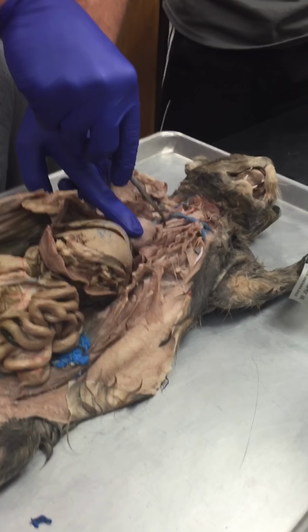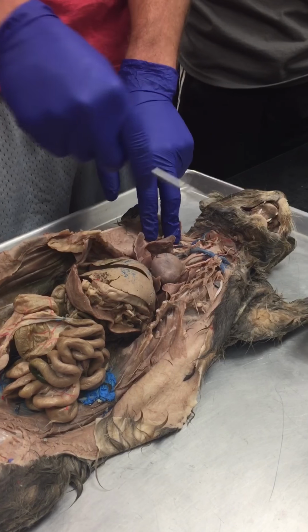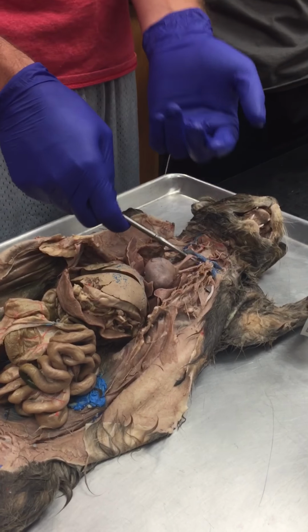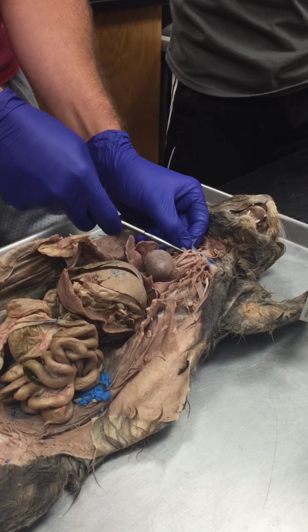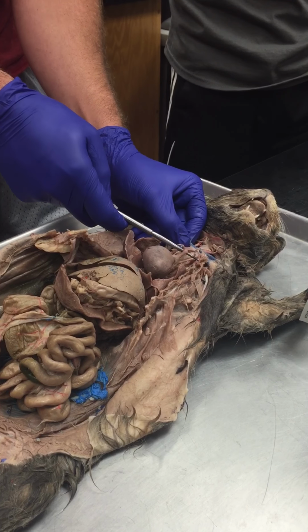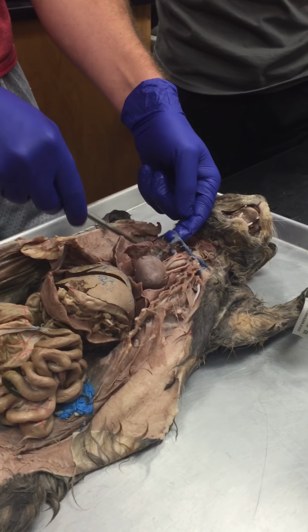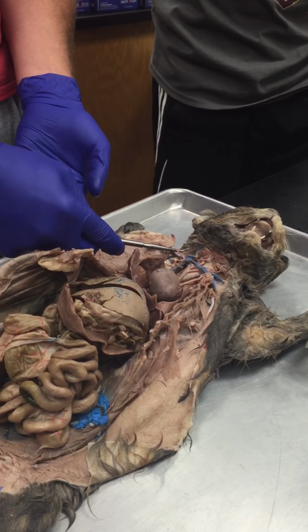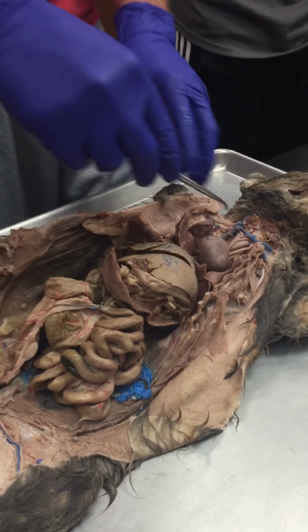So brachio means arm, okay? And cephalic means head. So the brachiocephalic artery is going to supply blood to the arm and the head. And there's going to be three branches off of it. So you can see pretty clearly there that it branches 3 times. This first one that branches off comes over here into the arm. This is going to be right subclavian. All right, it's bringing blood to the arm.